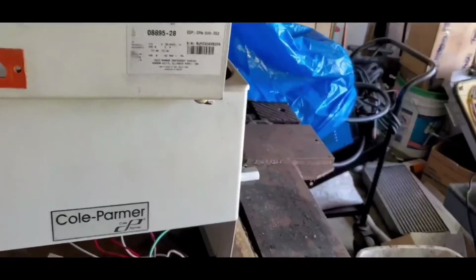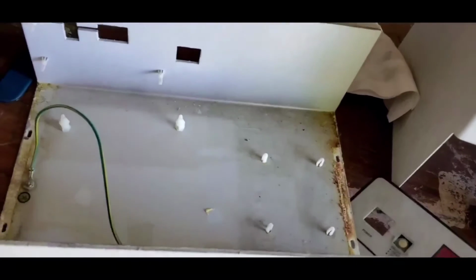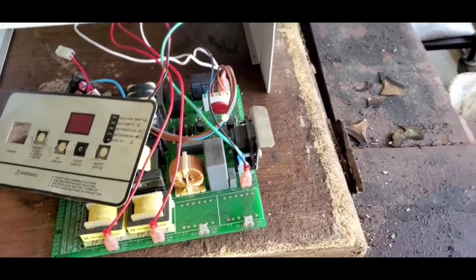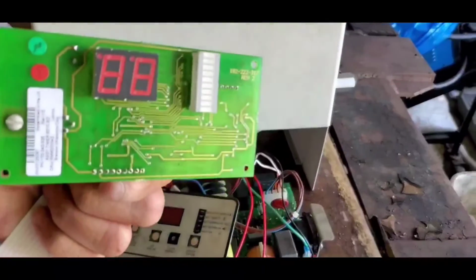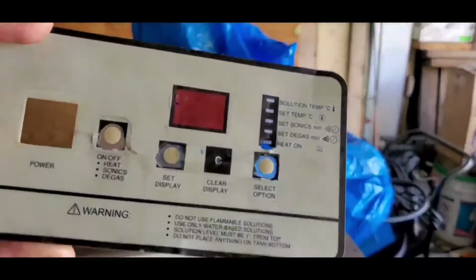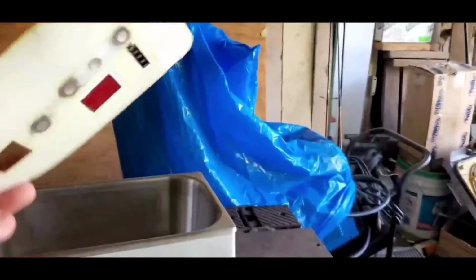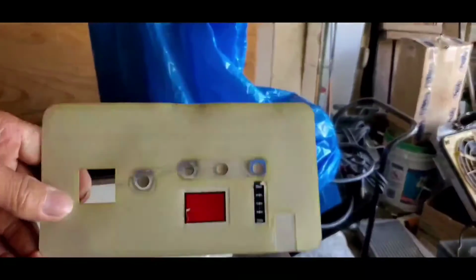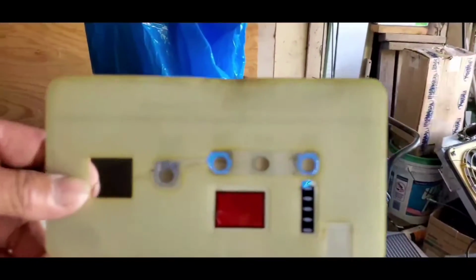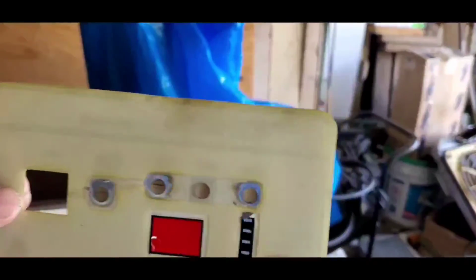Folks, this is the bottom cover of the ultrasonic cleaner. As you can see, the circuit board has been removed together with the display panel. This is the display panel, and the switches were supposed to be attached to this piece, but it's already gone. So what I did, I'm just gonna make a new one, DIY switches to make this thing work.